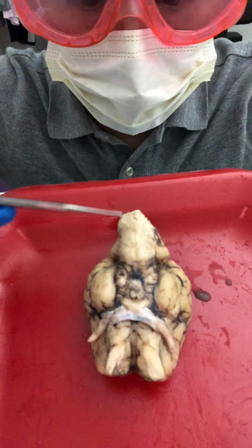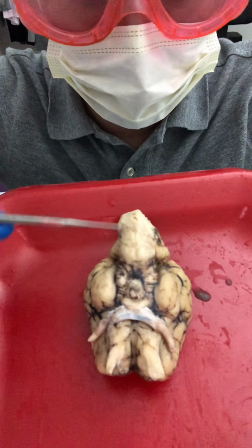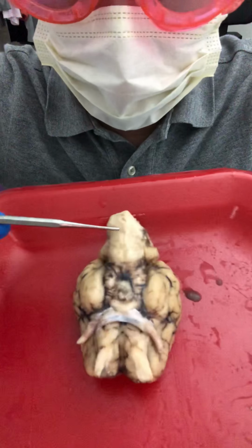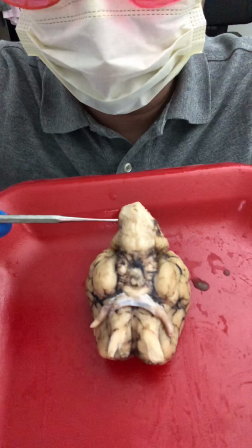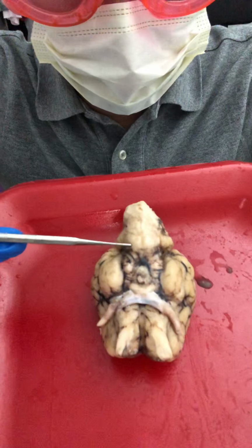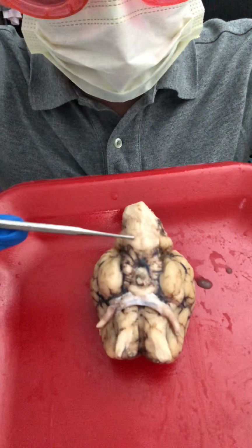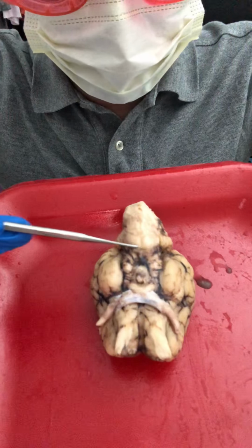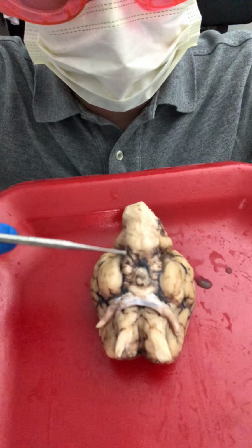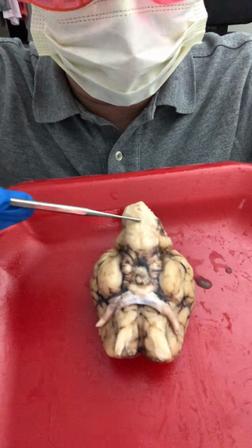We're going to start out with the bottom part, and this here is going to be the brain stem. This is the brain stem of the sheep brain. The sheep brain stem has 3 parts. It's going to have the midbrain, which is here. Let me make sure I identify that correctly. The midbrain. This thing that sticks out right here, that's going to be the pons, and after that, that's the medulla oblongata. So again, we're going with the brain stem: midbrain, pons, and medulla oblongata.